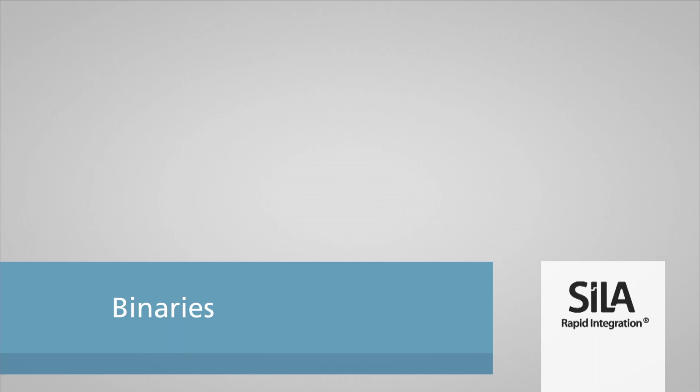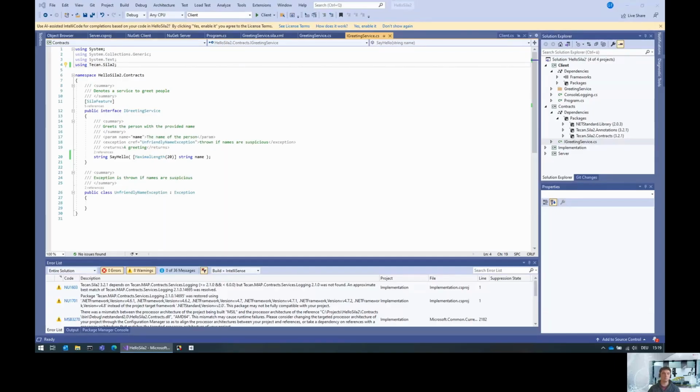Hello, my name is Georg Hinkel, and in this short video, I'm going to show you how to work with binaries in the Tecan SiLA 2 SDK. So what I wanted to do here is to basically say, okay, we have this greeting service that we developed in earlier editions of these tutorials. And we want to take in not just a name, but also some file and output a file with this greeting, as a signature or something like this.